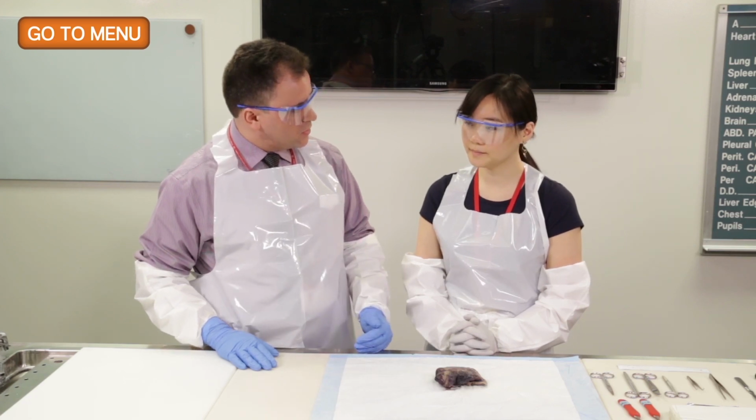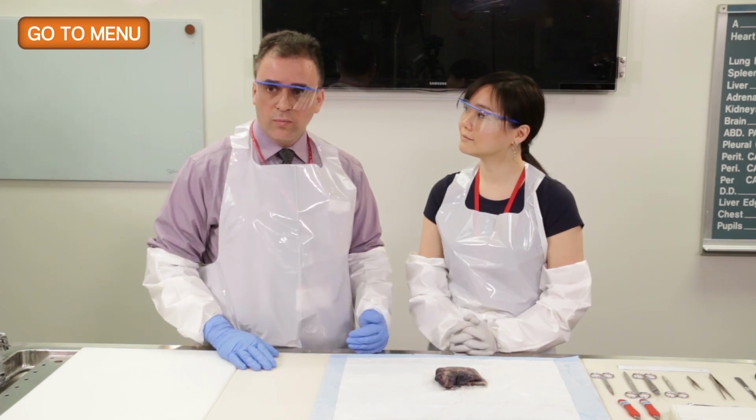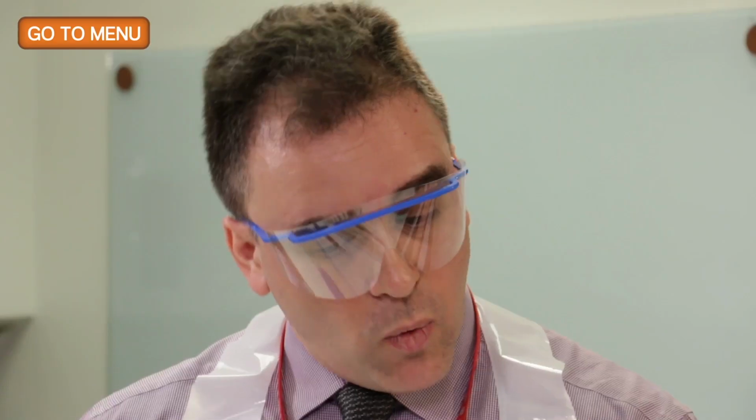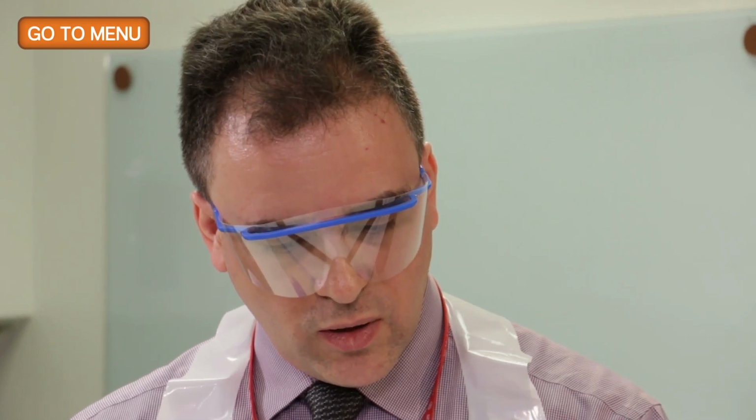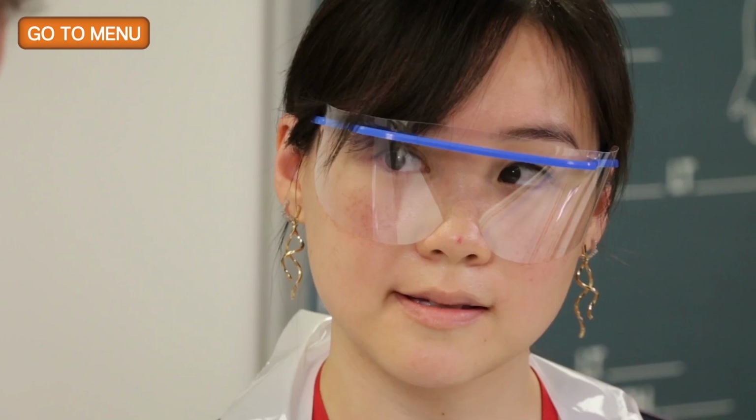However, we do get other specimen types in the laboratory in the resection of lung cancer. One of those is a smaller wedge resection. In a wedge resection, how would those details that you looked up help you? Well, for one thing, if we can find the mass, then we can correlate the gross mass size with what we find on CT or ultrasound or any sort of radiological findings. And then from there, we can also measure from the mass to the actual margin itself, which we would ink.